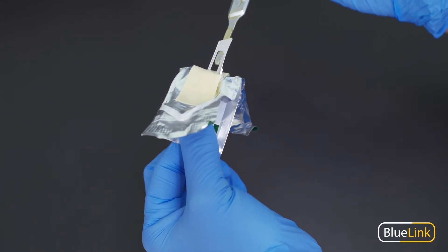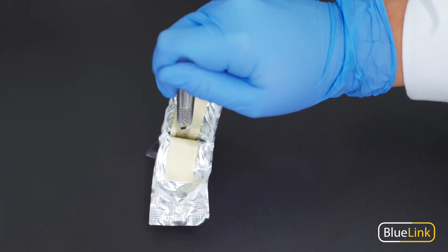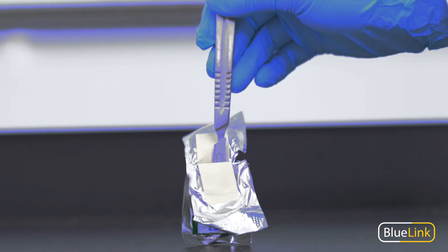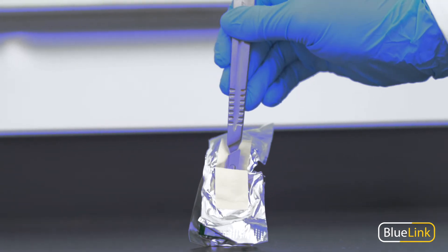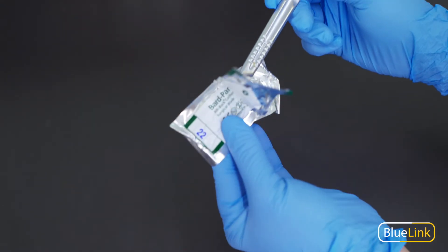And then I'm going to use the tabletop to press the handle downward until I hear a click that the blade is in place. And I'm ready to dissect.